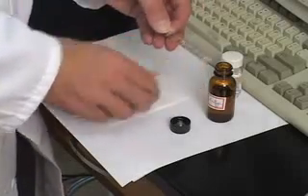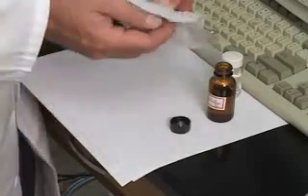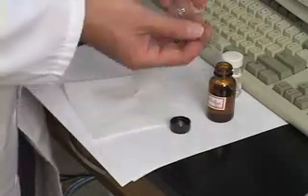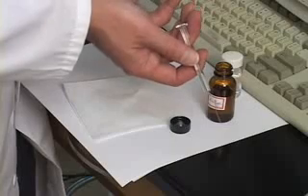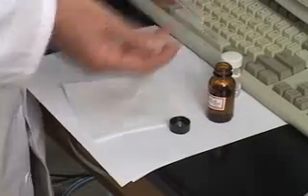Remove the plunger, but do not touch it, and then wipe it clean with the chem wipe. Reinsert the plunger into the syringe, and now it is ready for use for another injection.